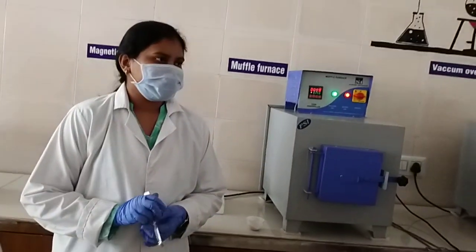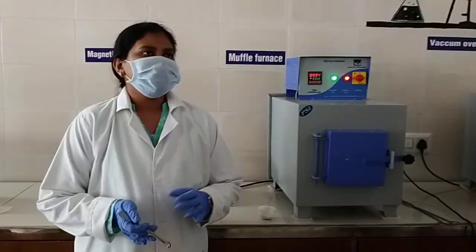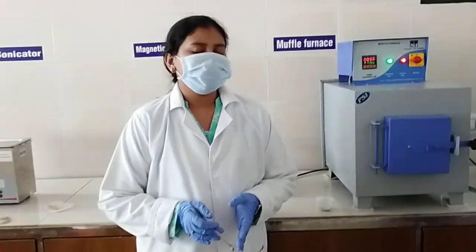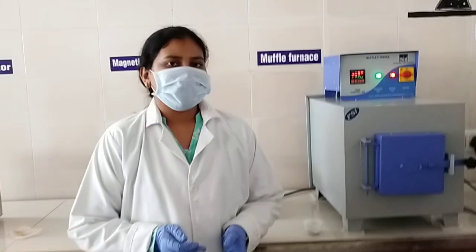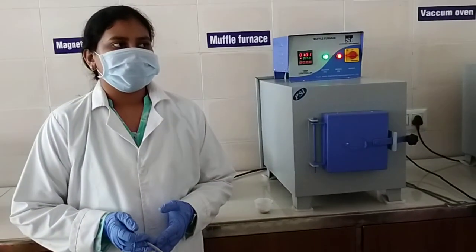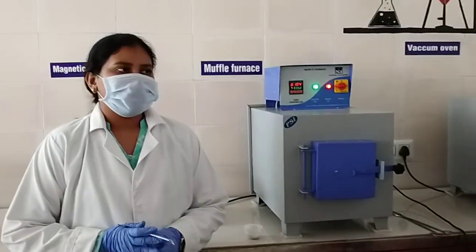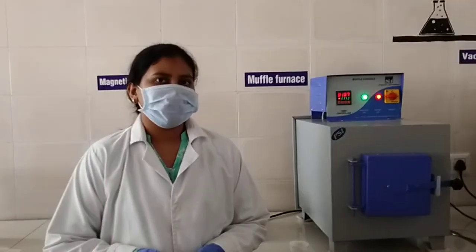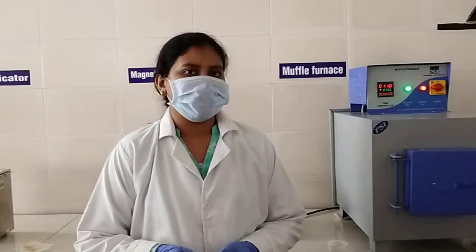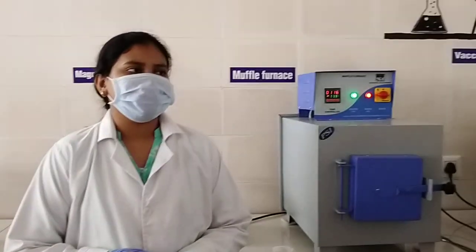Ma'am, what kind of green source can we use? Carbonaceous sources and agricultural waste like sugarcane bagasse, rice bran, and here I have taken amla leaf. How did you prepare this amla leaf product? Firstly I dried it in sunlight, chopped it and ground it in a blender, and directly used it. So you just dried it, converted it into powder and directly used it. That's really nice.